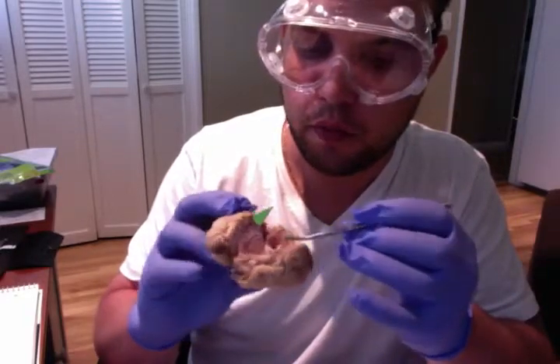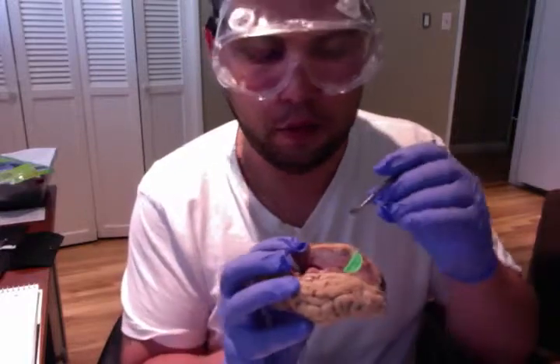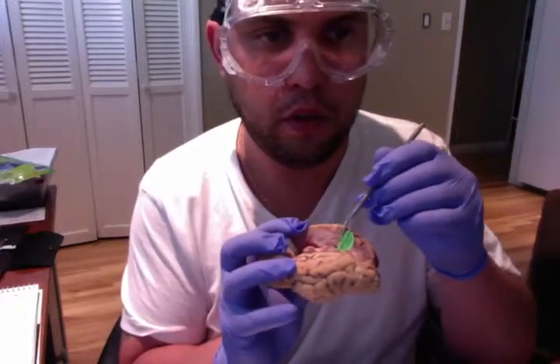So again, we've got that cerebellum here. And that concludes my video.